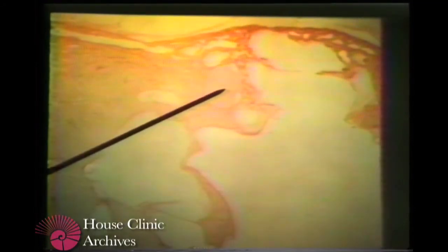Here we see the stapes in the oval window, the vestibule, the basal turn of the cochlea. There is a preparational artifact here showing a gap, the round window membrane, the facial nerve, the semicanal of the tensor tympani muscle, and the tegmen tympani. Notice how very thin this bone is here. This represents the middle ear space.